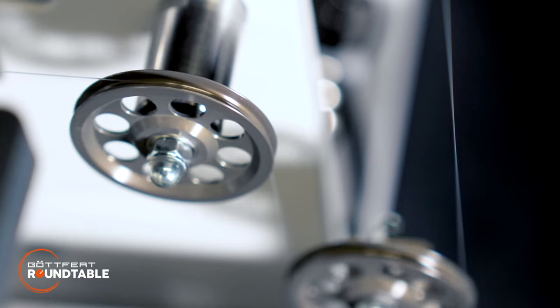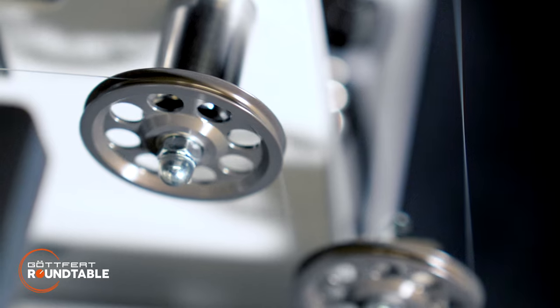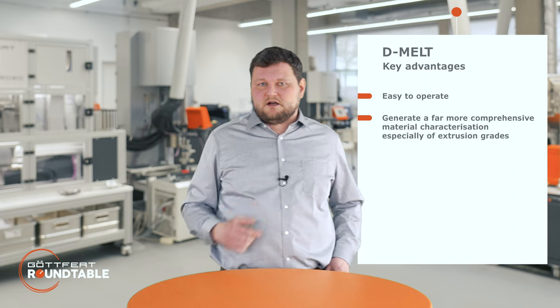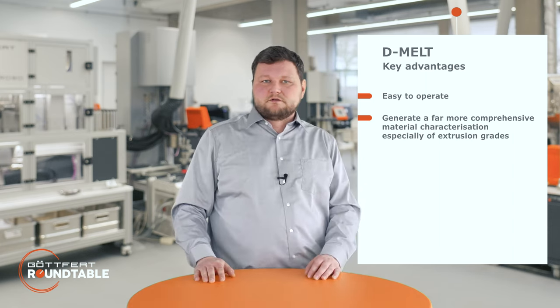Overall, in our experience, the system is highly sensitive and also selective. It can easily differentiate between different grades. Often you have to interpret both numbers together, and this correlates quite well with the behavior in the actual application. Overall, we think the system is very easy to operate and will give you a far more comprehensive material characterization compared to just melt indexing, and it's especially useful for extrusion grades.